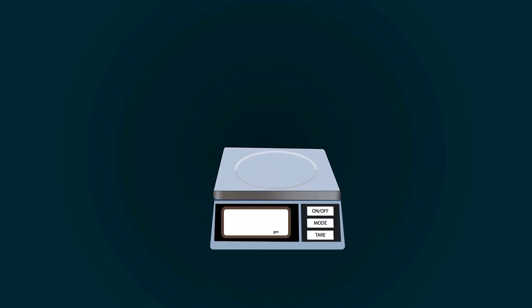First of all, take a weight balance and power it on. Now, put a petri dish on it. Don't forget to tare it down.